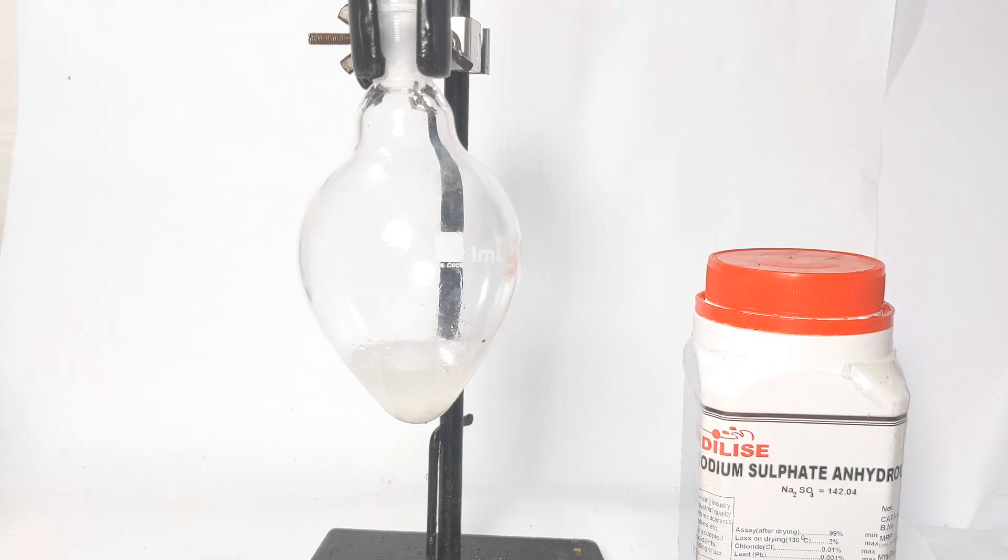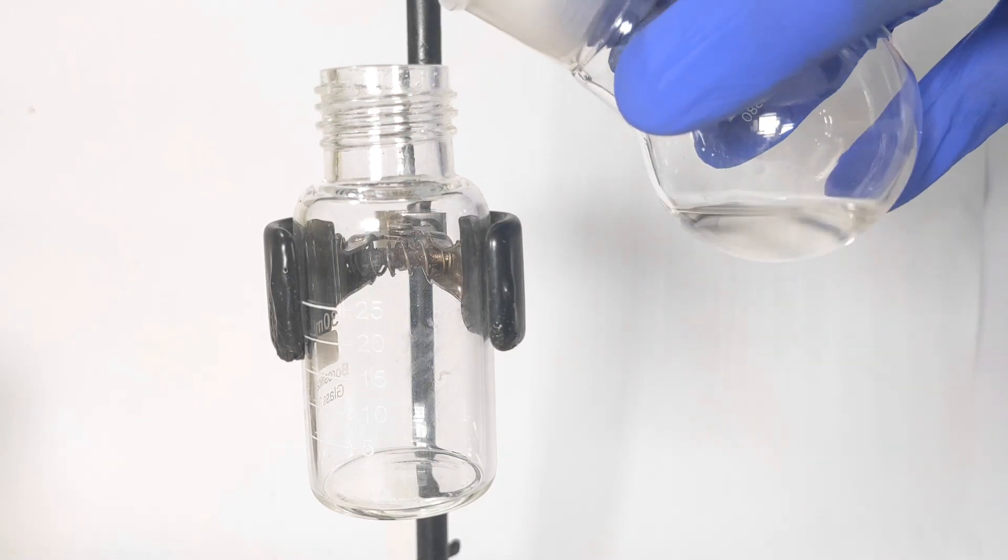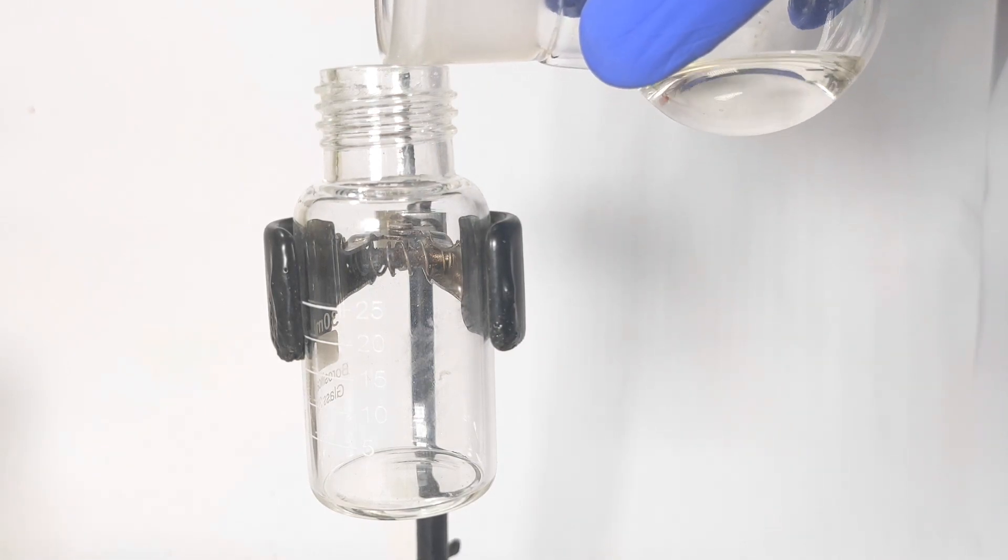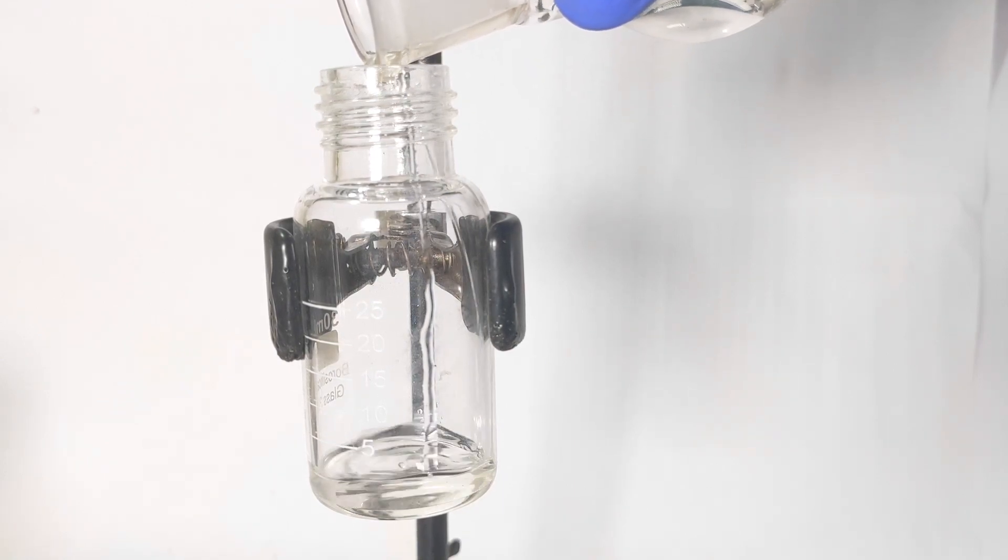And this is the 1-chlorohexane. If you want you can redistill the 1-chlorohexane to get a much purer product, but since I am lazy to do that I am ending the procedure here.